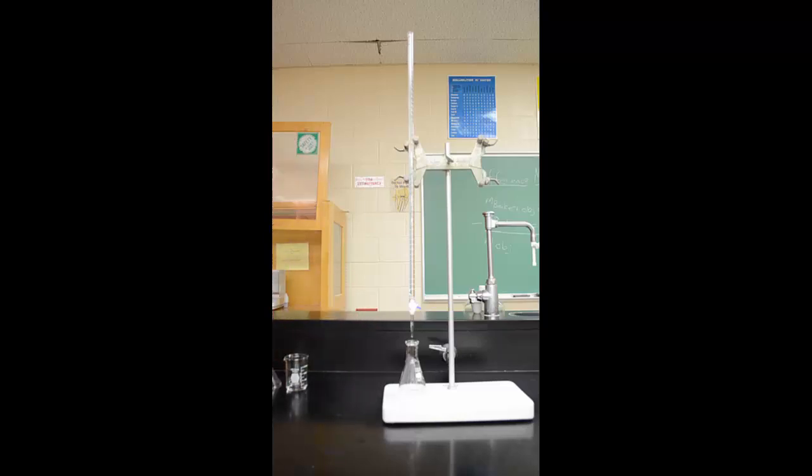For the initial volume, I am going to read from the zero side, counting 10, 15, 16, 17, 18, 19, 20. The meniscus is just below 20, between 20 and 21, so 20 would be my tens and ones place. And it goes down 1, 2, so it would be 20.2, and then I have to guess that last spot, 20.23. That would be my initial volume for this reading.